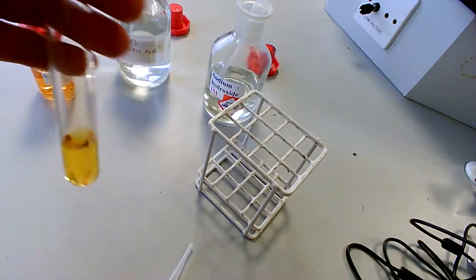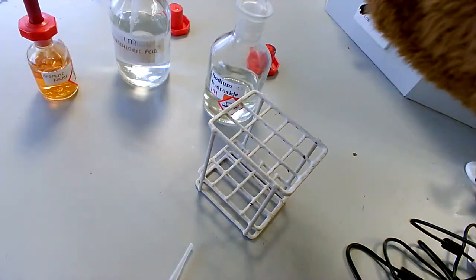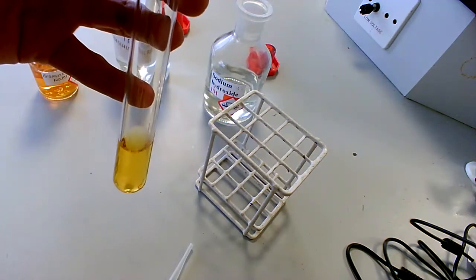I'm going to start by adding sodium hydroxide, about a centimeter cubed, but it doesn't really matter too much. So notice what happens when I add it.